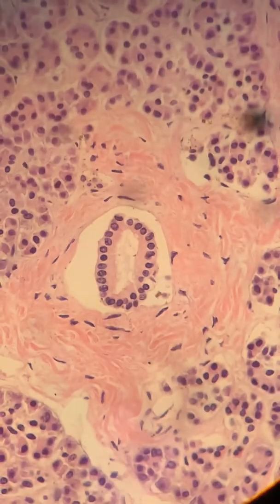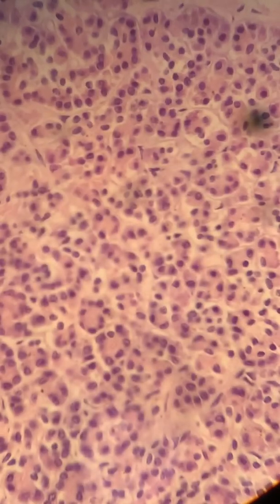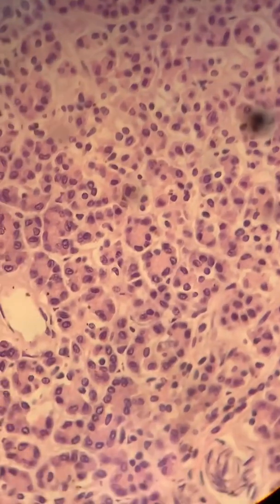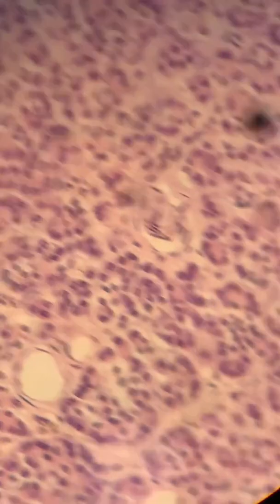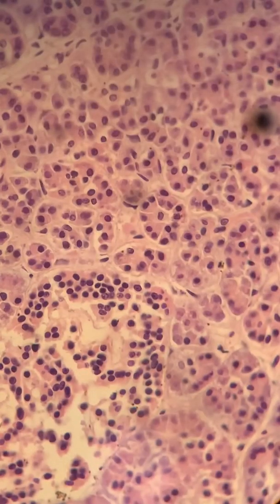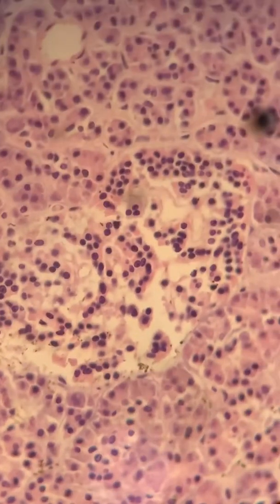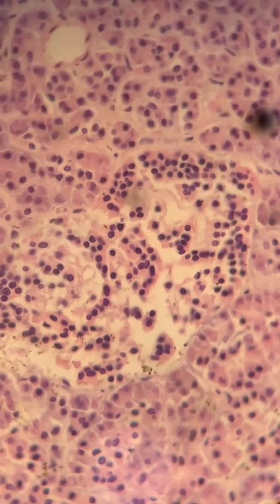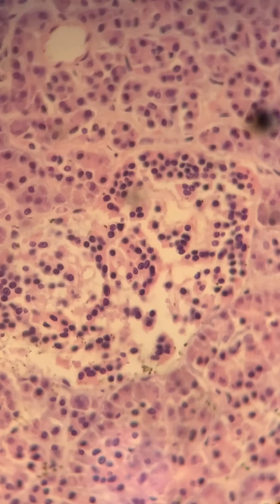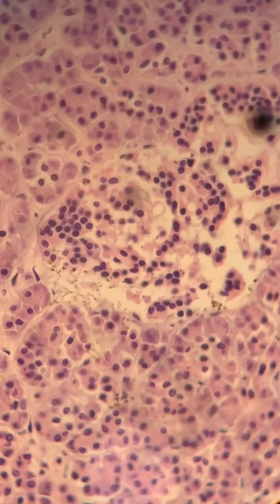This is good histology — just to review pancreatic histology. Still more acinar cells. Let's see if we can get some islet cells. Okay, there are some islet cells right there — that's beautiful. Those are the cells that make insulin; those are the beta cells.